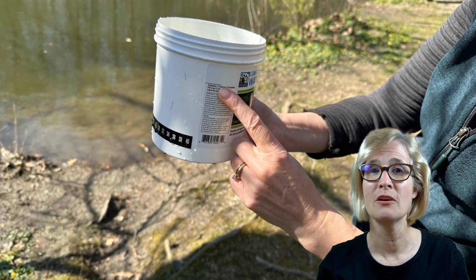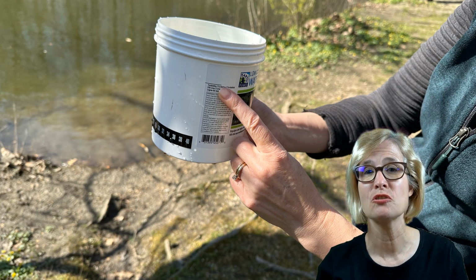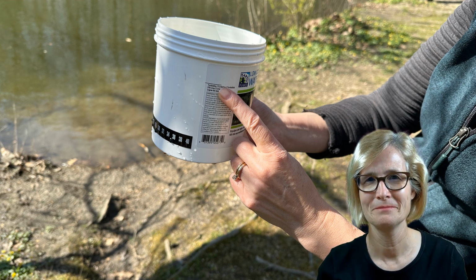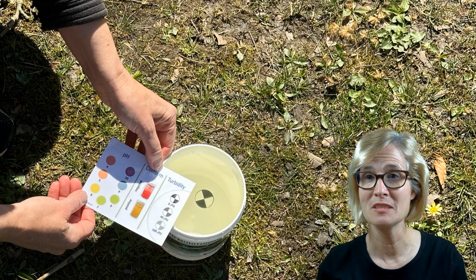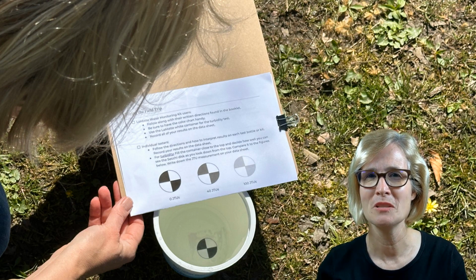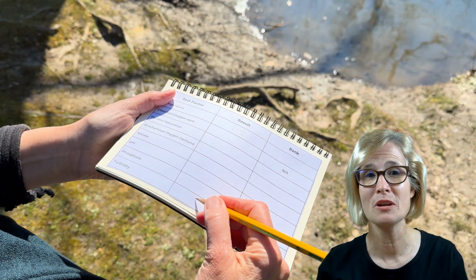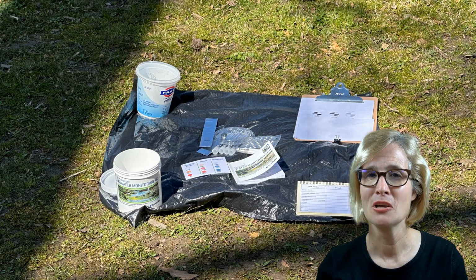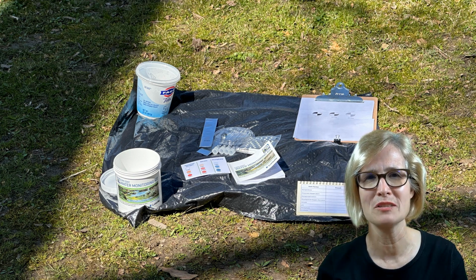Now, once you have the water, for the turbidity, make sure the water in the bucket is filled to the indicated line. Then look down and compare the Secchi disc to the options on the chart or on your field trip guide worksheet. Determine the JTU's measurement and record it in your datasheet. Use the water now to perform the other tests. It's best to do your chemical tests at your site so you don't have to lug the water home, and in case you need more water at some point.